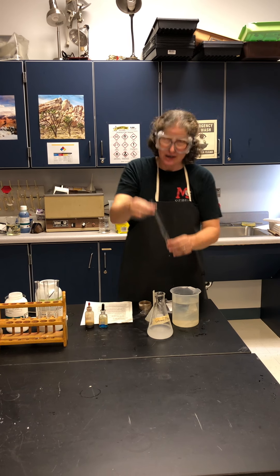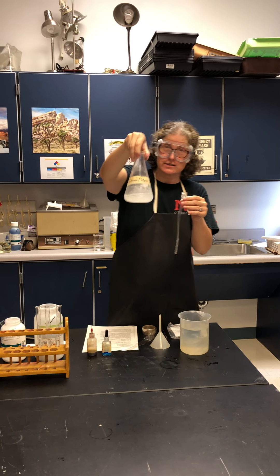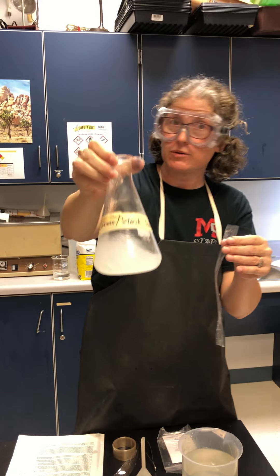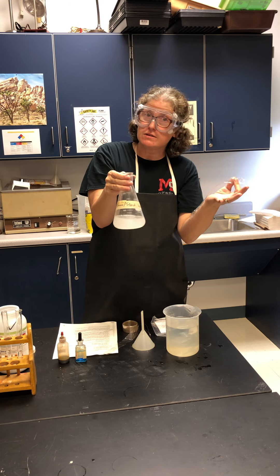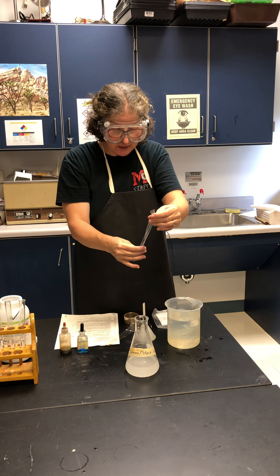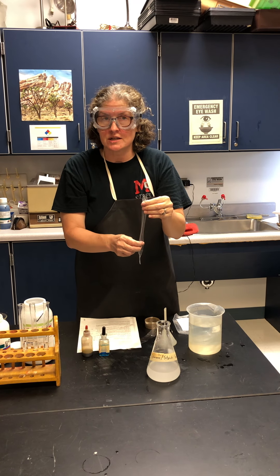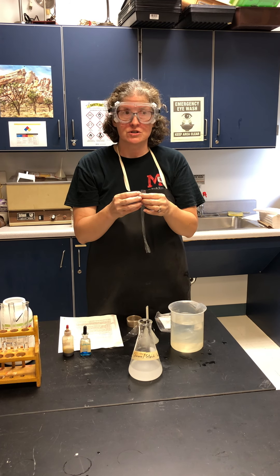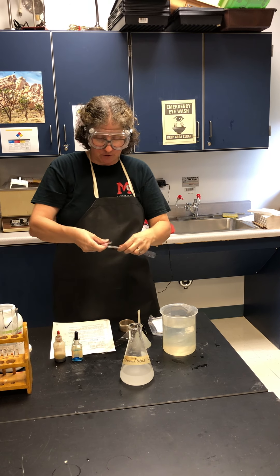We're going to use this tubing to make an artificial cell with some glucose and starch inside it. The glucose and starch solution is kind of opaque and white. Try to remember the molecular structure of glucose versus starch in terms of size — that will be important. We're going to immerse it in a solution with chemical indicators to see if either of those molecules are able to move out into the surrounding solution.